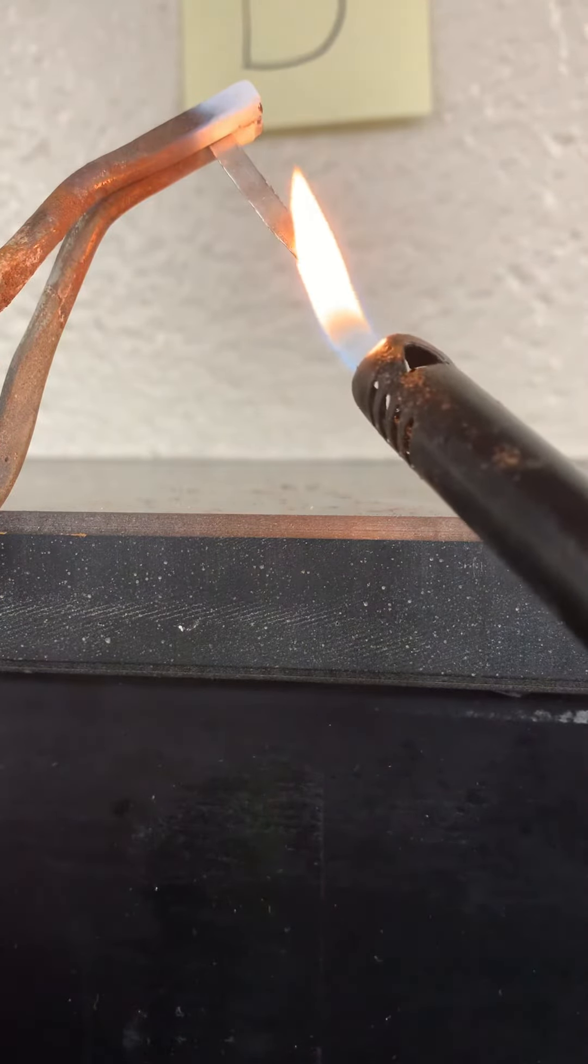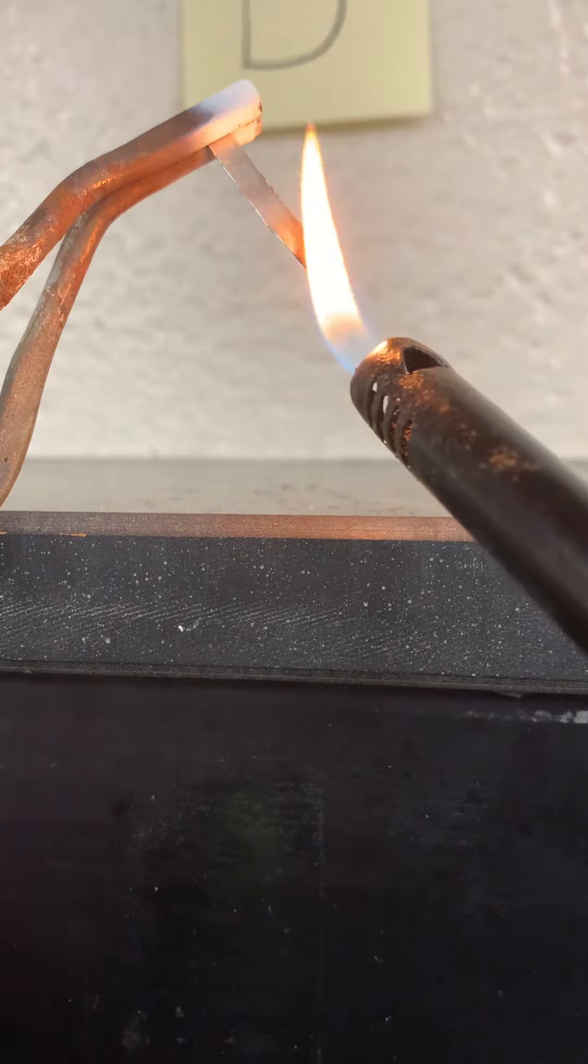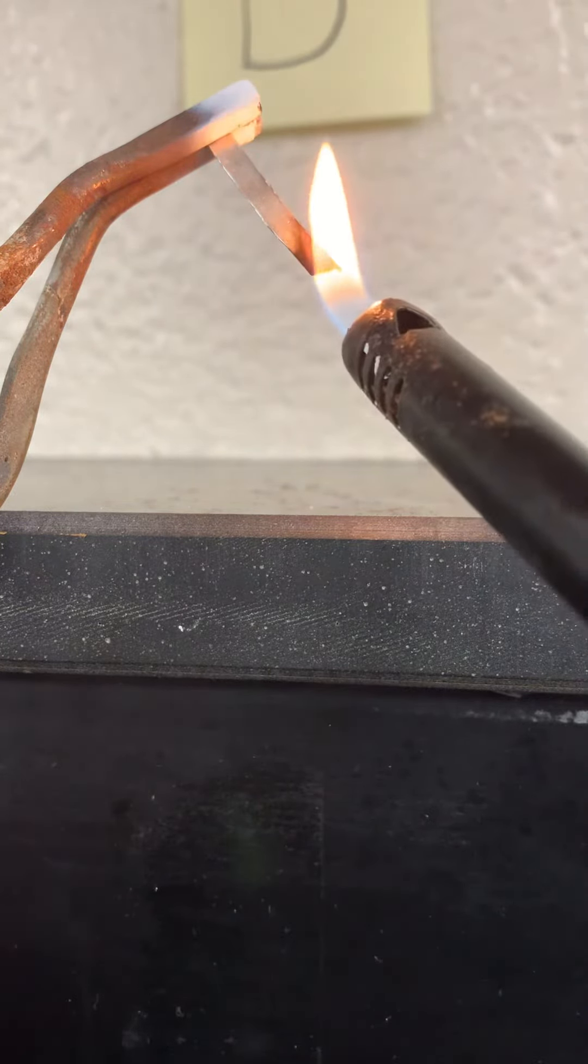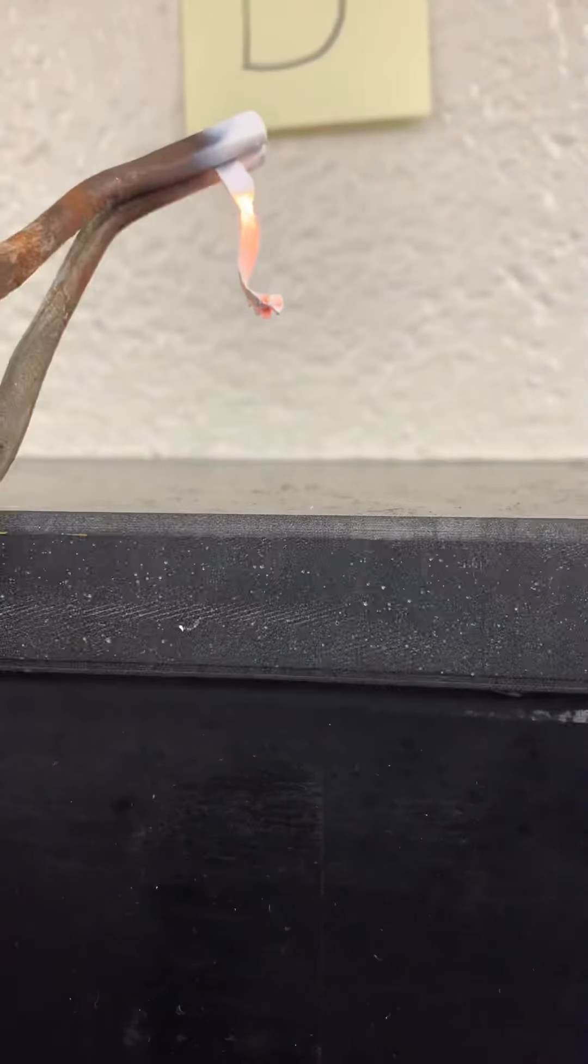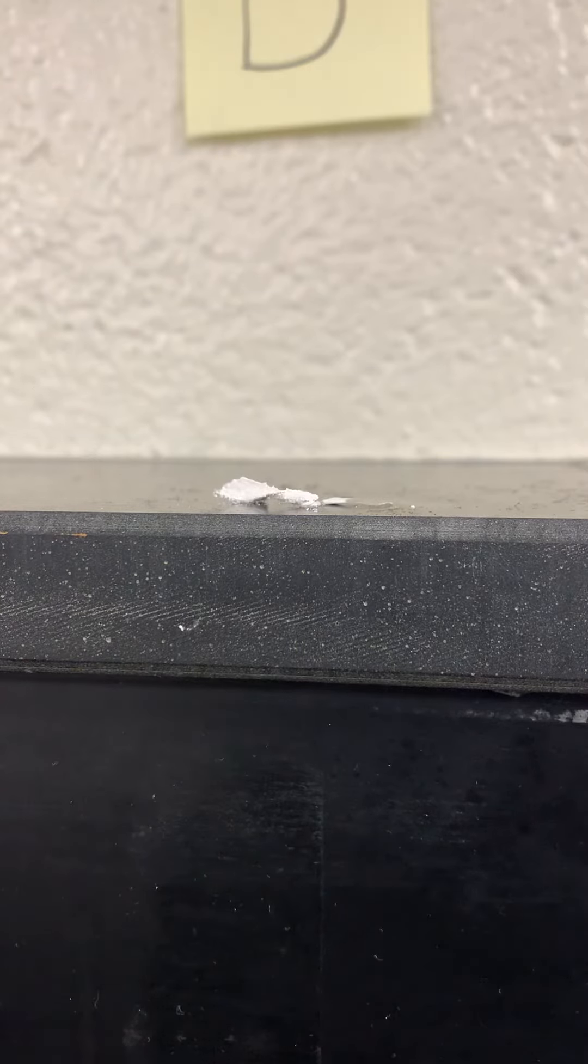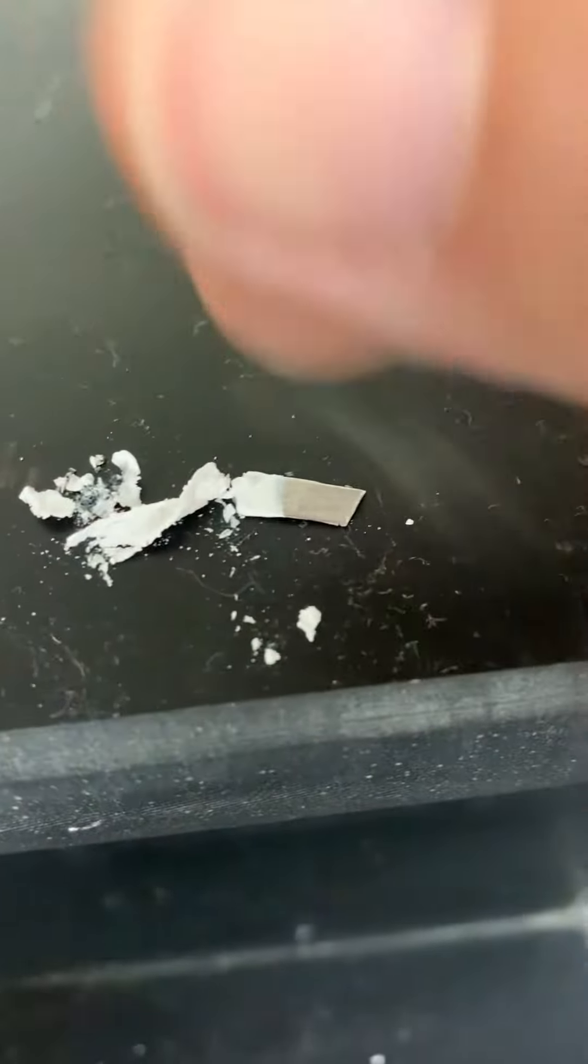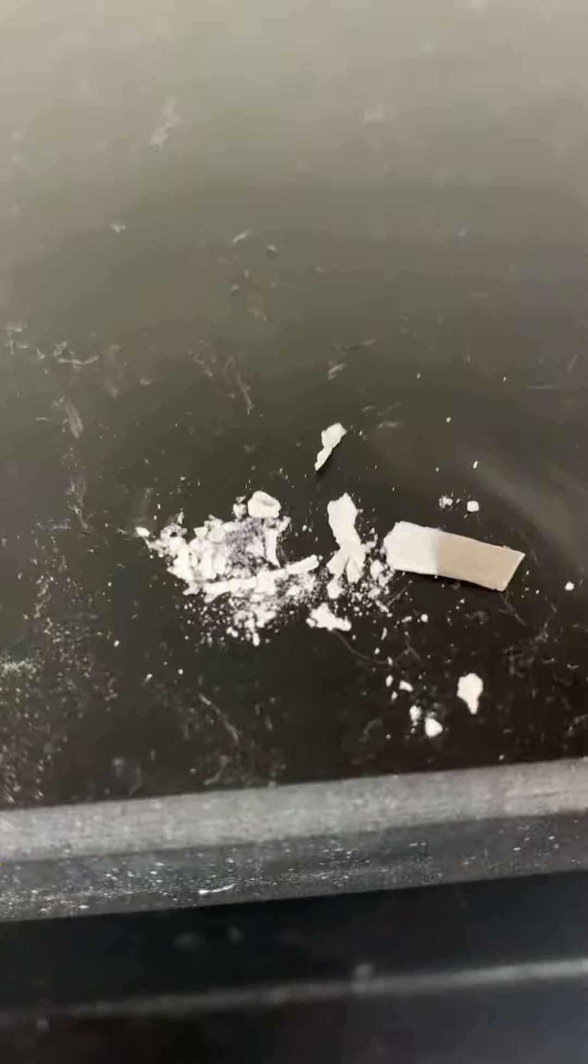So that's what the observation looked like during. And now we'll take a look at what it looks like after. I know you can't feel it, but it's a powdery material right there. That's what it looks like after the reaction.